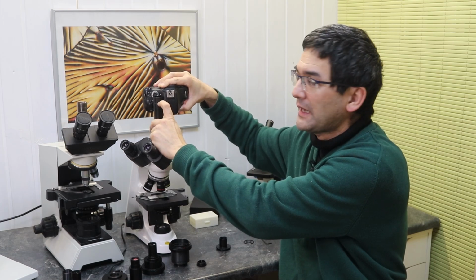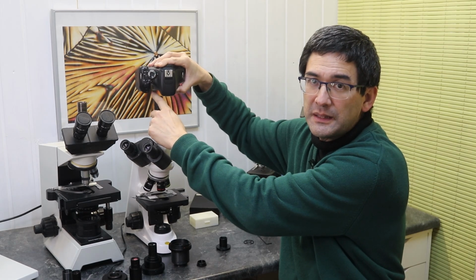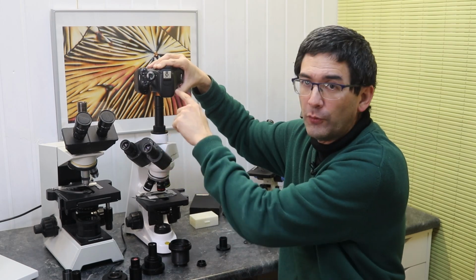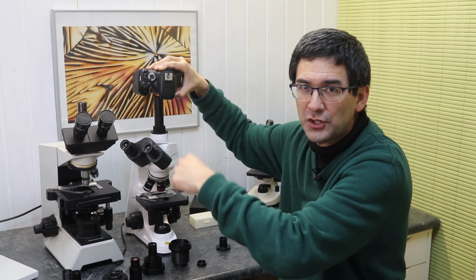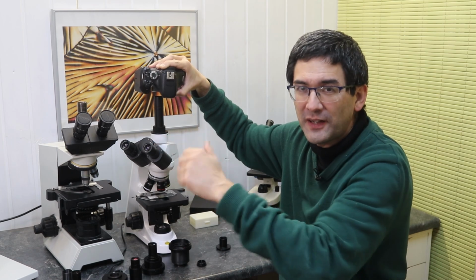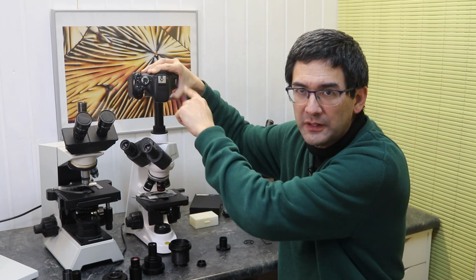If I now connect the camera up here somehow by making an adapter without optics, then the problem is it's not in focus, and I have to really strongly defocus the microscope, and then I also risk crashing the optics into the slide and so on, and finding the focus is very difficult. So I think it's really important that both of them are parfocal and in focus.